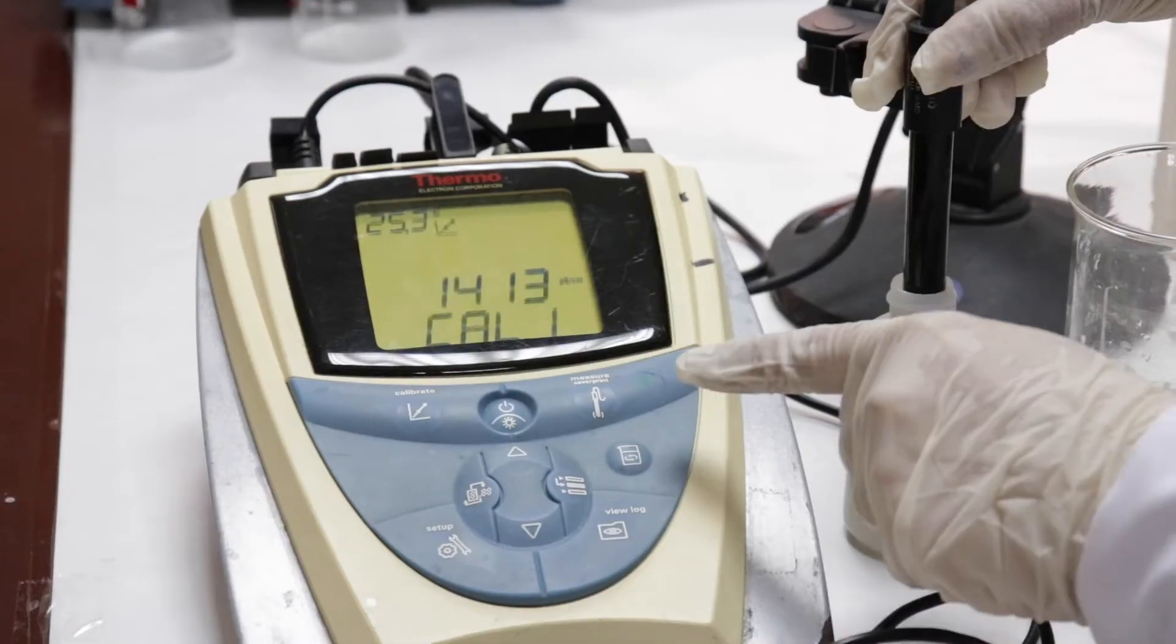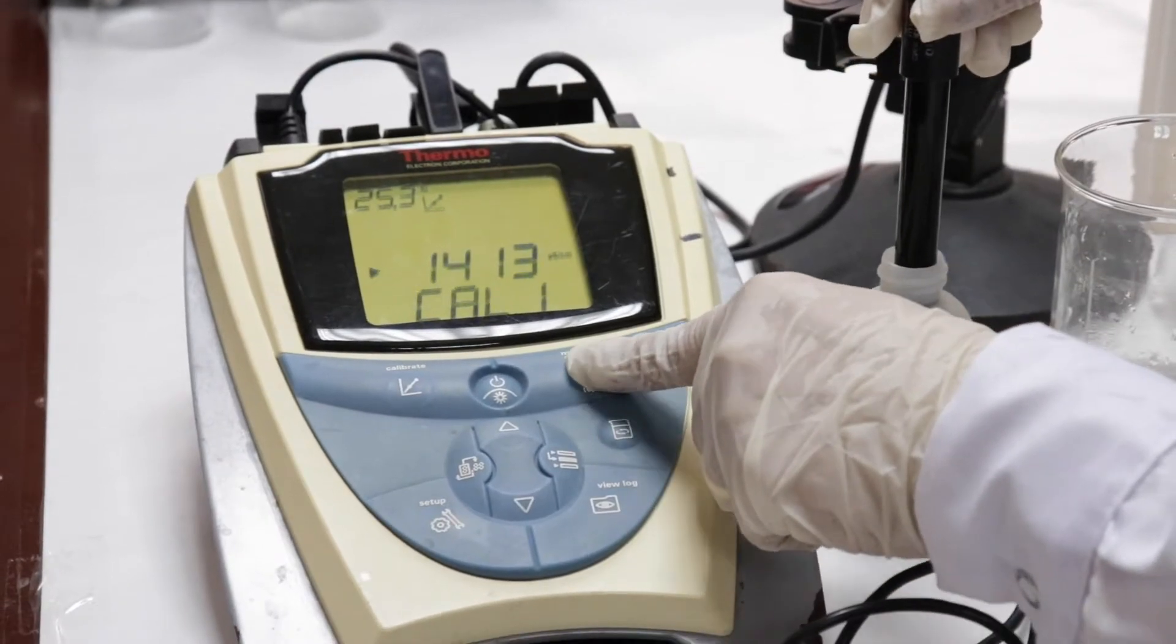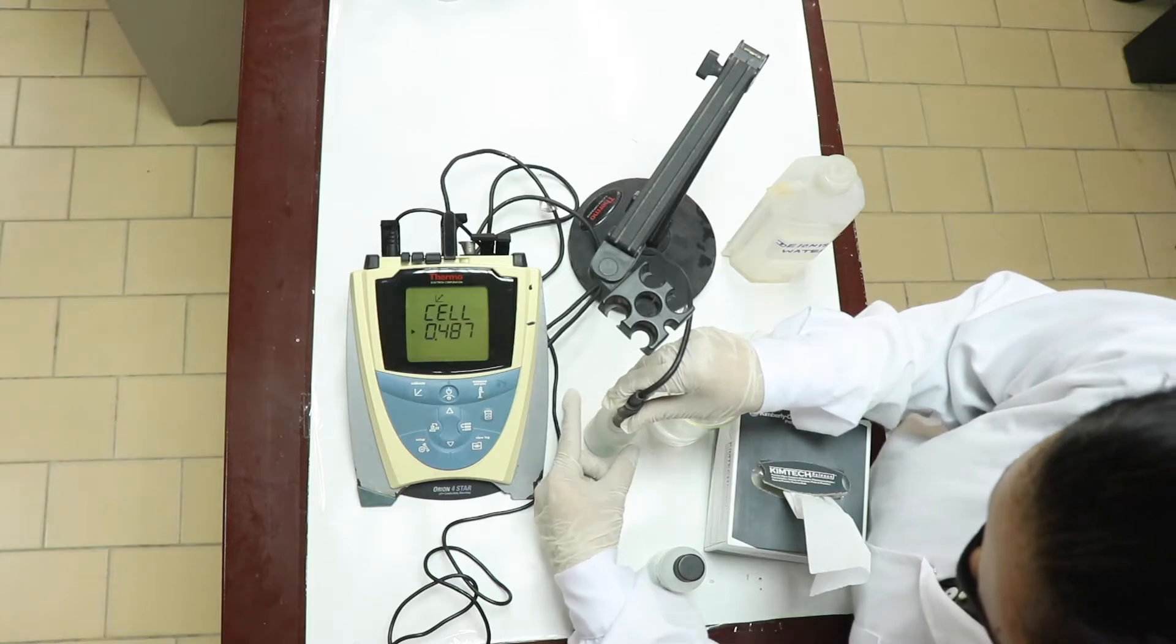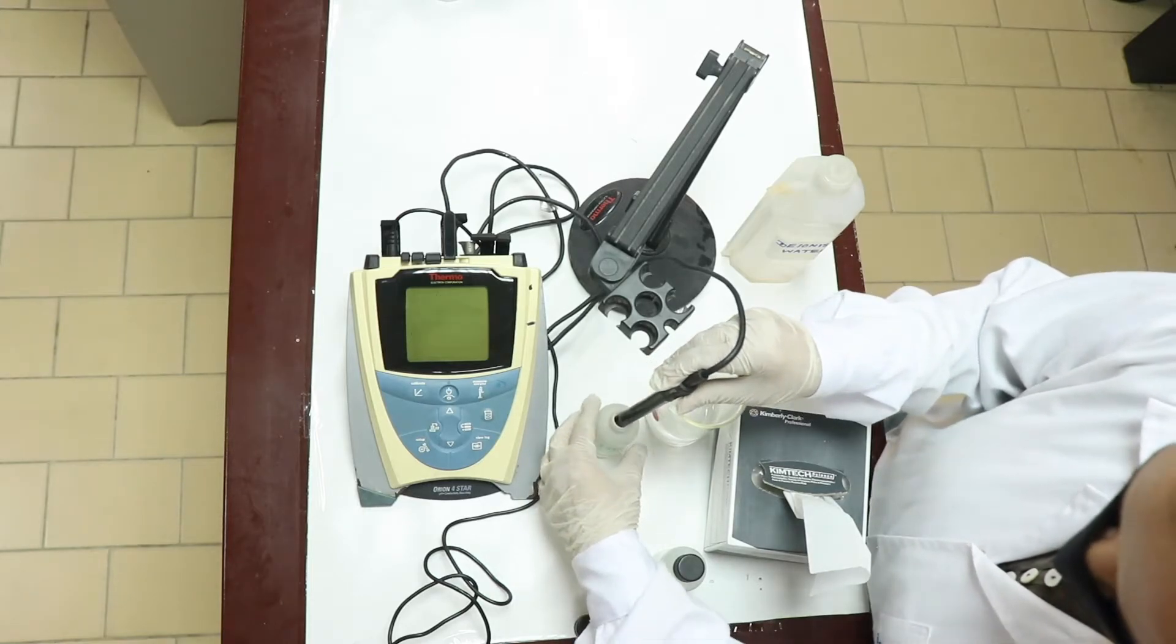After that, you have to press the same measure. It is written here measure. Just press that. Now this value is saved. Similarly, we have to do for the other solution also.